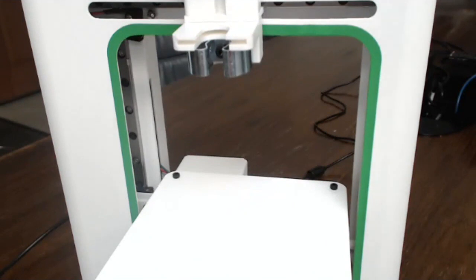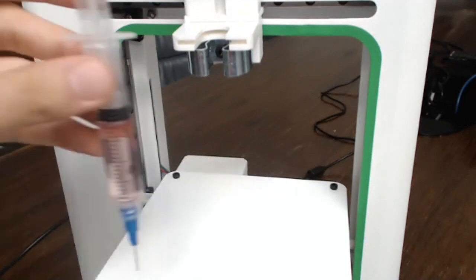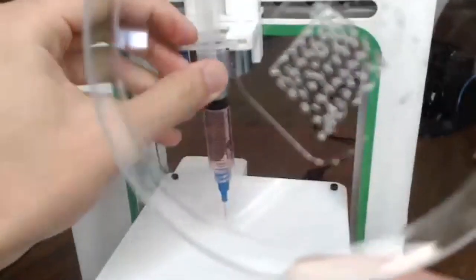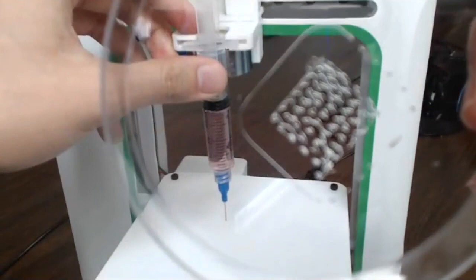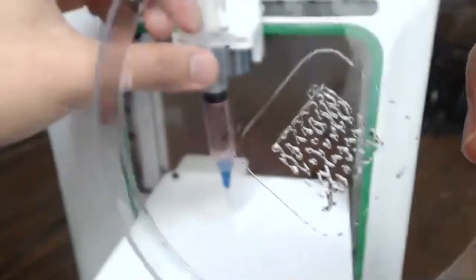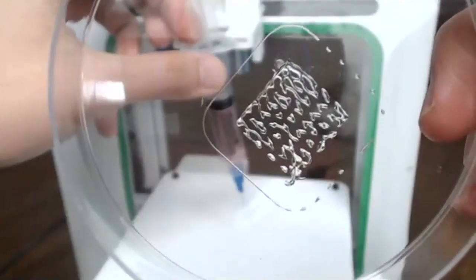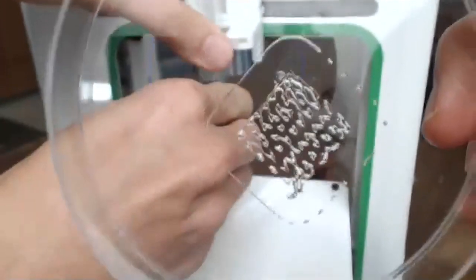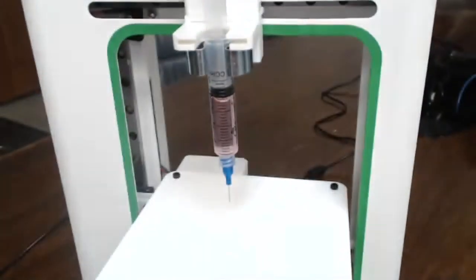Oh, was this with the too low extrusion multiplier? I see. So I think previously Oliver did a print that has too low of an extrusion multiplier, and you can see here the scaffold is inconsistent. The prints are very inconsistent. And so you do need to adjust the extrusion multiplier to the right setting in order to get the right amount of material coming out. So he's going to show you with the adjusted parameters what the print will look like.